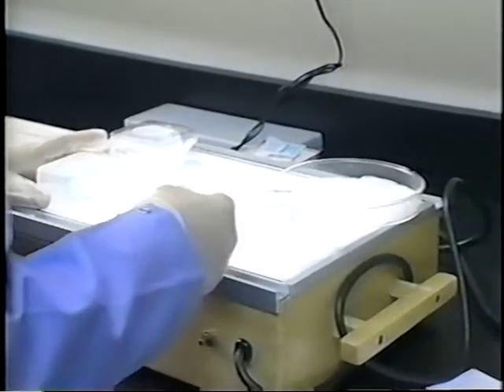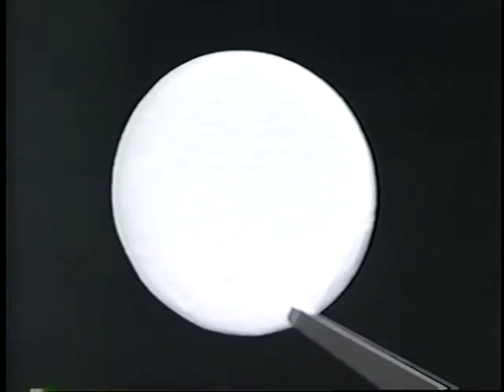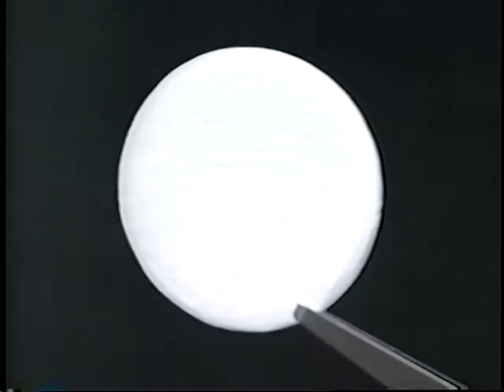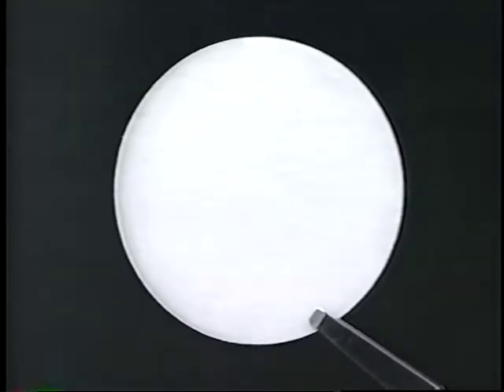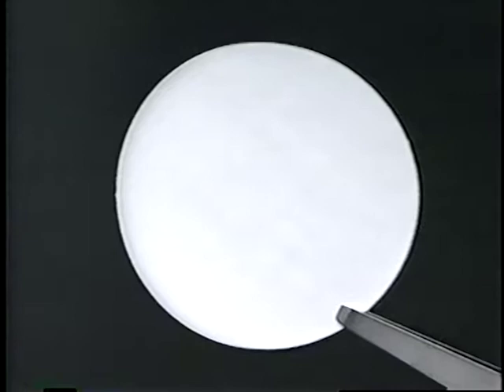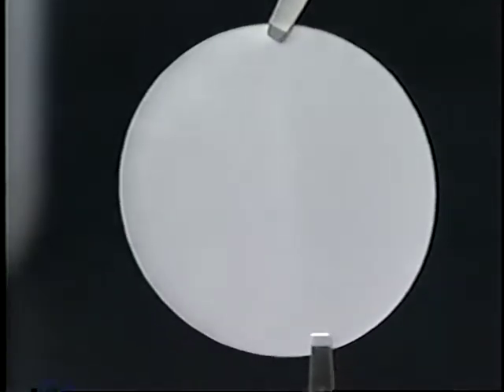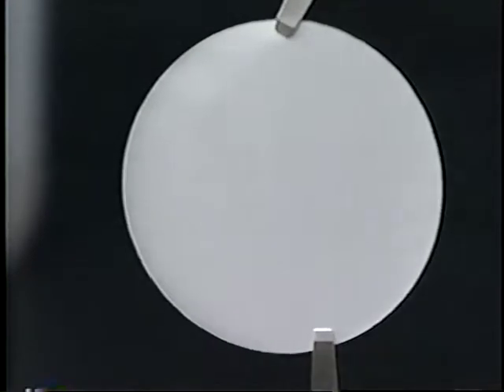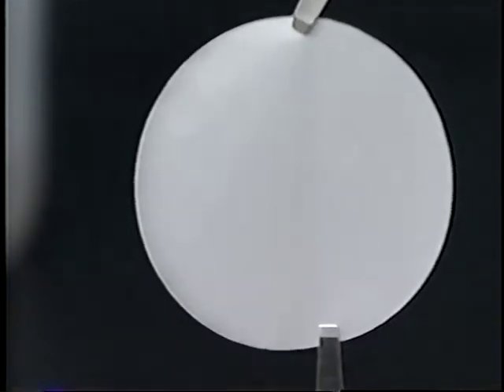selected or handled. Teflon membrane and quartz fiber filters are the most commonly used for the PM2.5 and PM10 chemical analyses. In addition, cellulose fiber filters and nylon membrane filters are used to collect gaseous precursors. Etched polycarbonate membrane filters are best suited for microscopic or individual particle analyses.